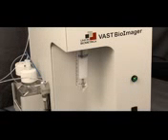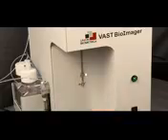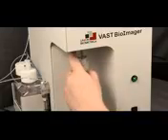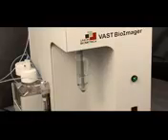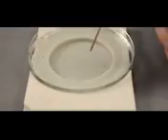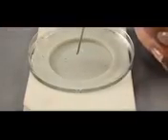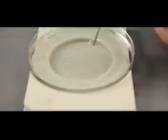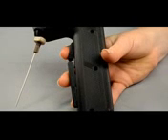Samples may be introduced using several different methods. Each VAST is equipped with a 50 mil conical sample mount containing a mixing sample probe. The mixing rate, oscillation, and loading speed are a few variables controlled by user input. If sample number is small or user pre-selection is desired, the VAST pipetter can be employed to draw individual larvae, one at a time, into the VAST system for sample processing. Simply position the probe's end near the fish and press the top button to draw up the larva. Pressing both buttons transfers the larva to the VAST sample line for automatic processing.